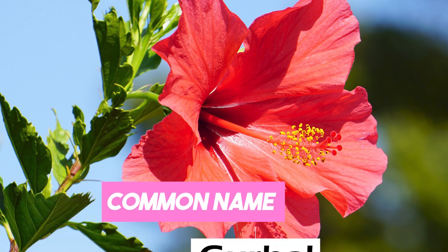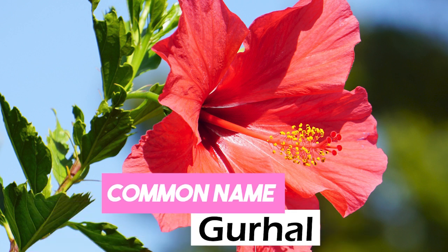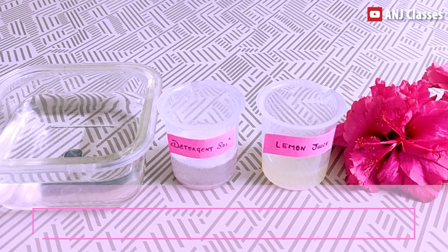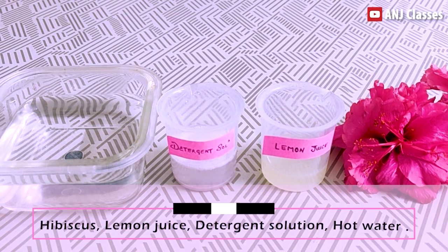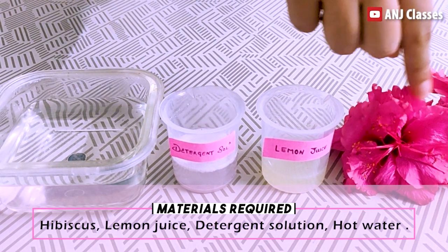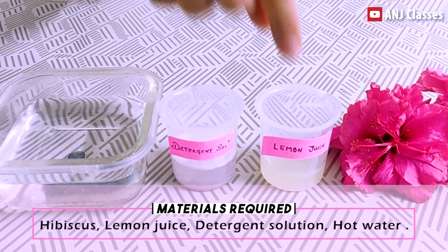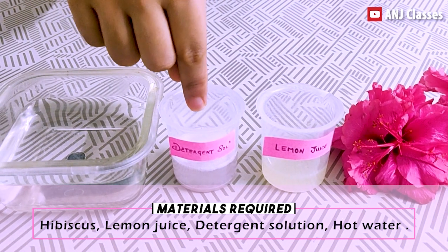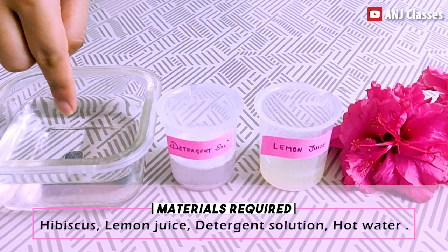In Hindi we also call it Gudhal. The materials required for this activity are Hibiscus flower, lemon juice, detergent solution, and hot water.